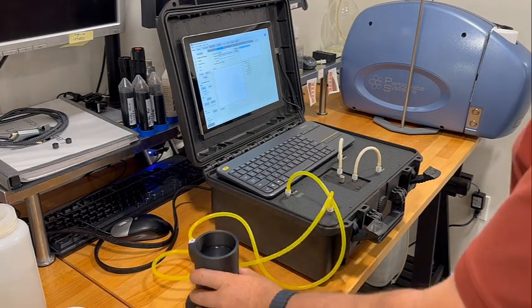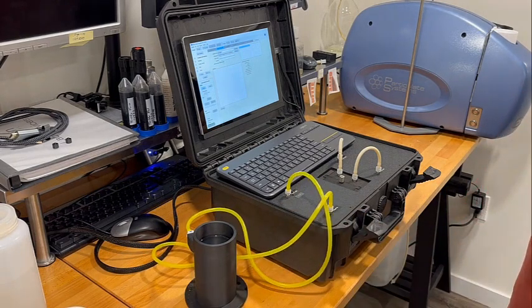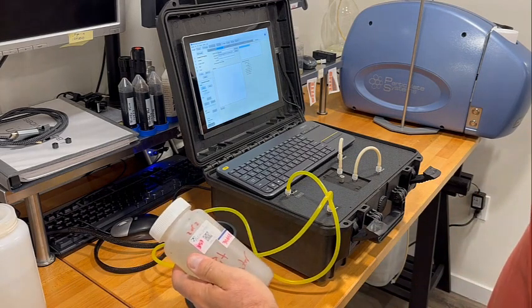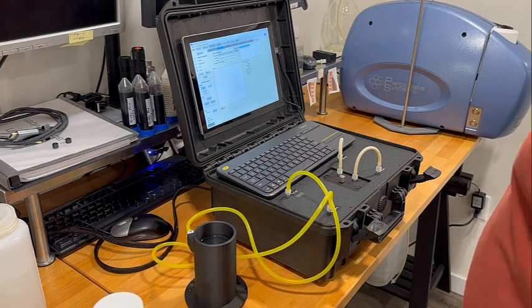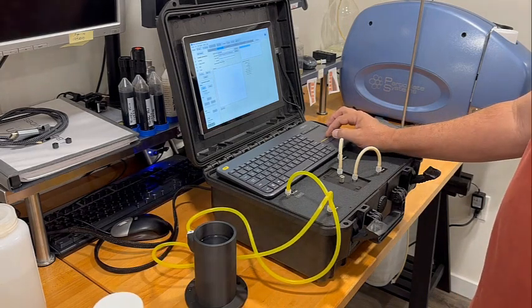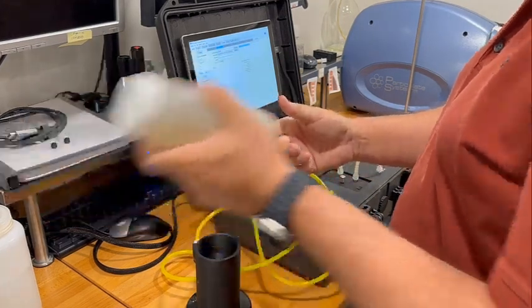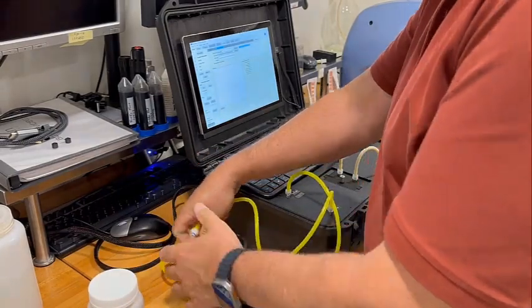As you can tell, there's a very flexible fluidics. There's external tubing that goes to a sample vessel that comes with the instrument. And there's also the ability to plumb into just about any kind of application. In this case, we're going to be doing some wastewater samples, and we're going to be disconnecting the reservoir that you see here. And we're going to actually run this wastewater sample that was collected and sent in.